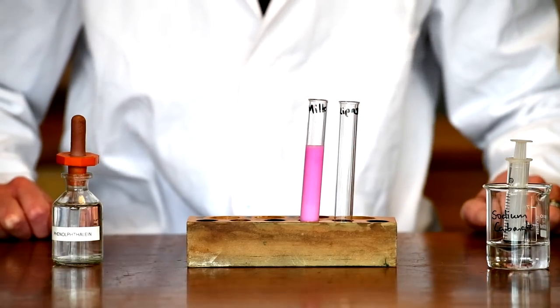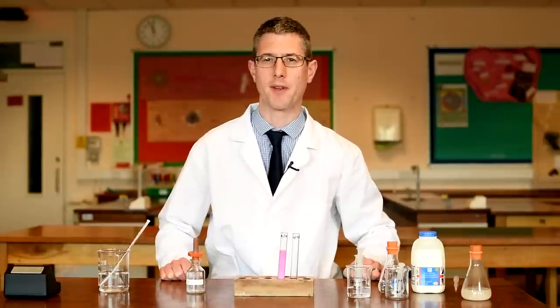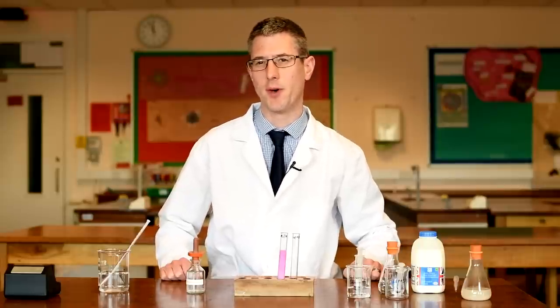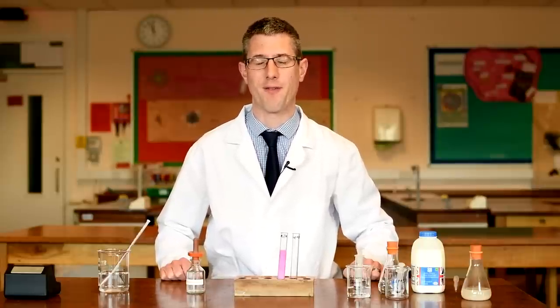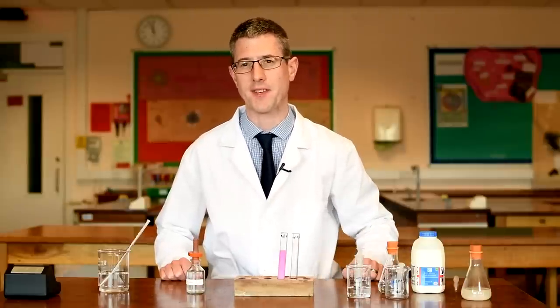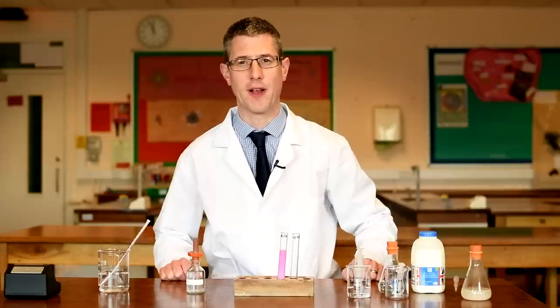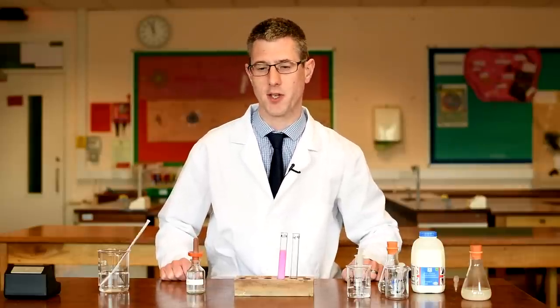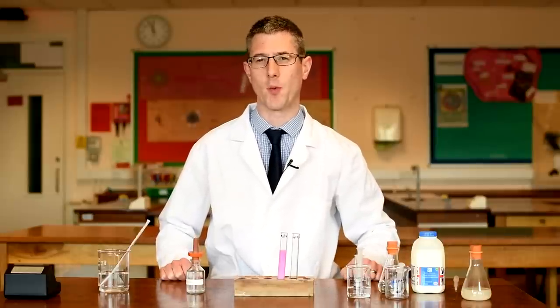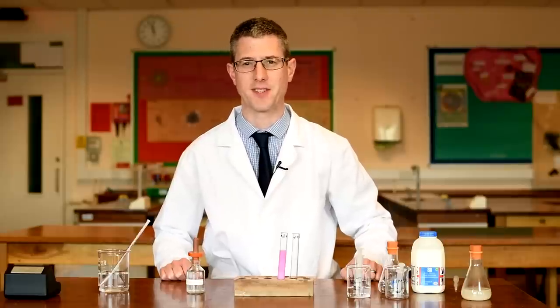This milk is going to decolourise during the experiment and we're going to be measuring the time it takes for that to happen. The reason this will happen is because as milk decays, it becomes more acidic. The lipids in the milk will break down into glycerol and fatty acids, and it's those fatty acids that are going to lower the pH down to pH 8.2 and below. At pH 8.2, phenolphthalein becomes decolourised, so we'll lose the pinky-purple colour — and that is what we're going to measure as our dependent variable: the time it takes for that to happen at different temperatures.